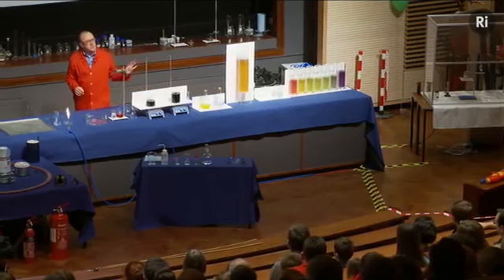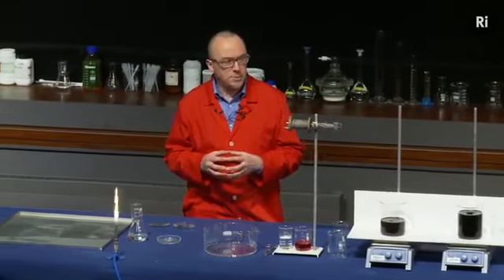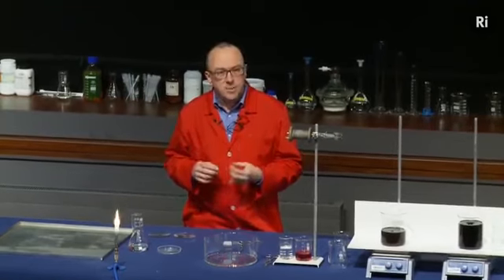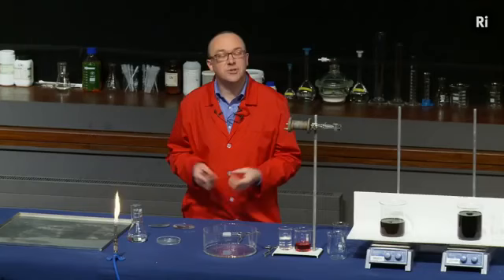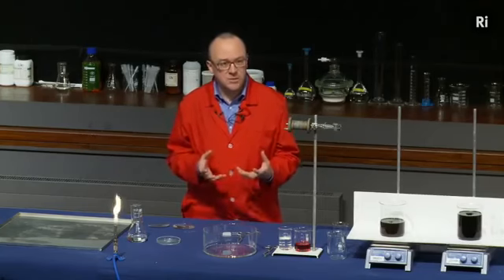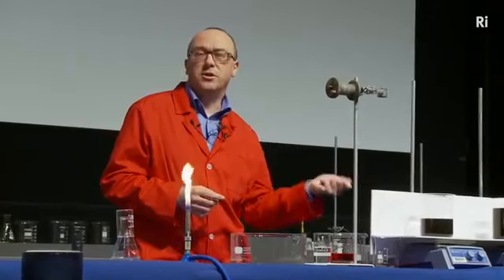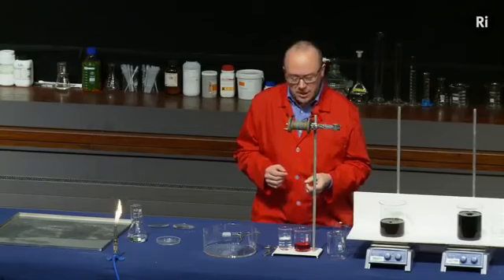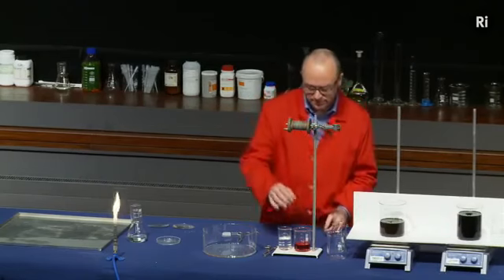So in the reactions we've seen so far, we mix chemicals together and we know that a reaction has taken place because we get a change of colour. But there are lots of other ways that a chemical reaction can show up. One way is called a change of state. The state of something just means whether it's a solid or liquid or a gas. So if something turns from a solid to a liquid or from a gas to a solid, then it's changed state. Let me show you an example of a chemical reaction that involves a change of state.